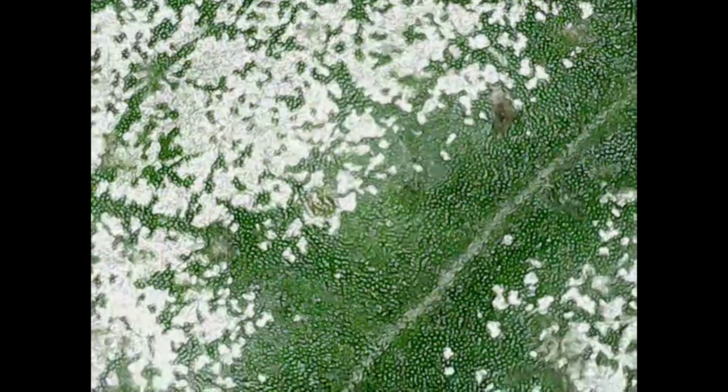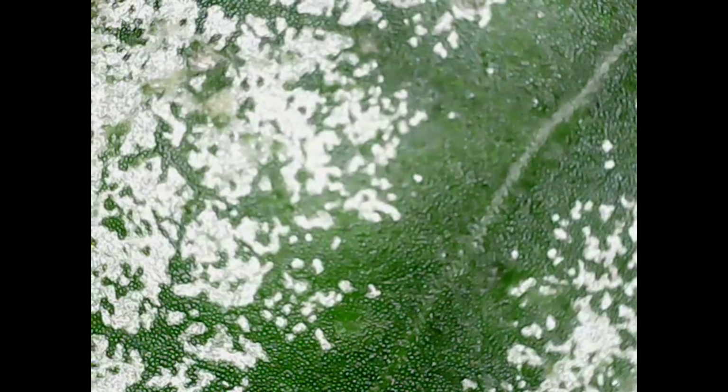So here you can see that silveriness, and you might be able to see that puckering that's happening there with the white sections that are coming across as white under the microscope, but those are little blisters of air that are stuck between the layers of the actual leaf itself, which I thought was quite interesting to look at and see what it would look like under the microscope. I think I've got some more close-ups coming up just now.